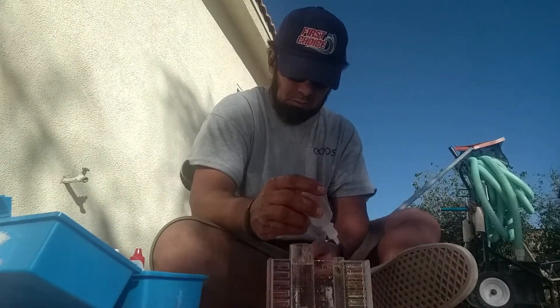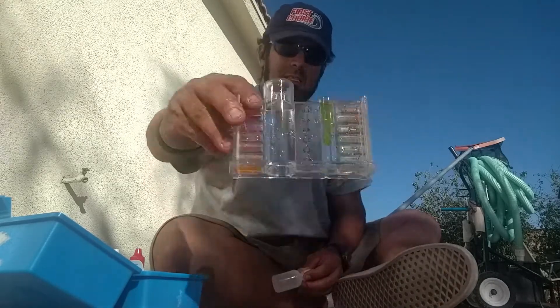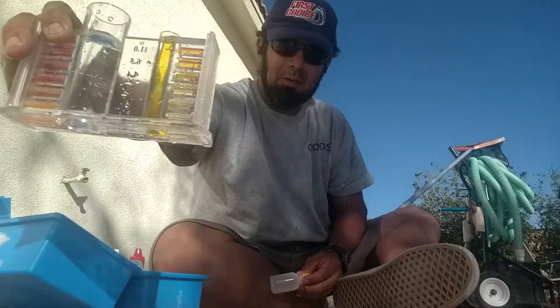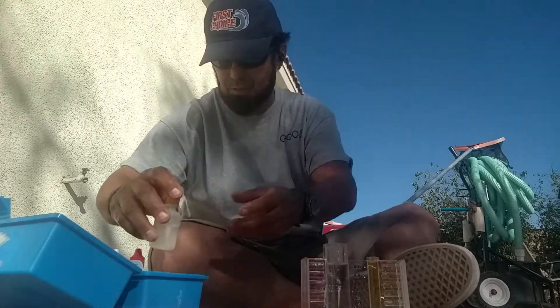Five drops of yellow — one, two, three, four, five. As you can see, it's a nice yellow color — almost like an amber. Pretty nice and dark. You know you've got a pretty good residual there.